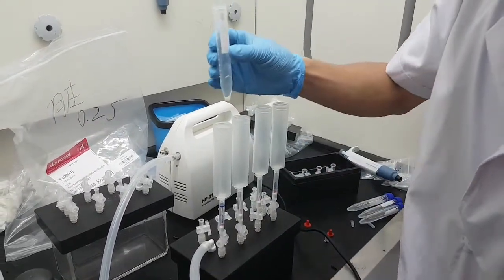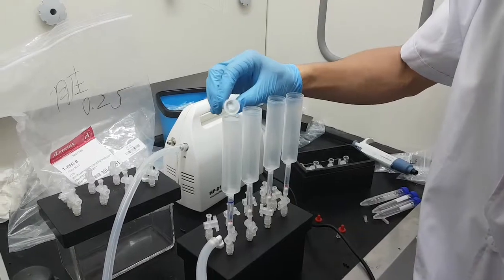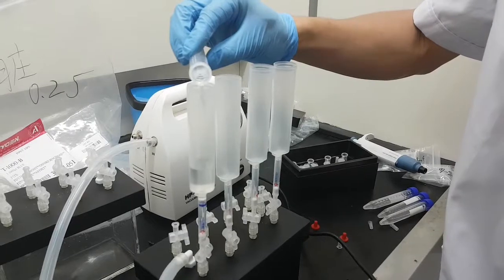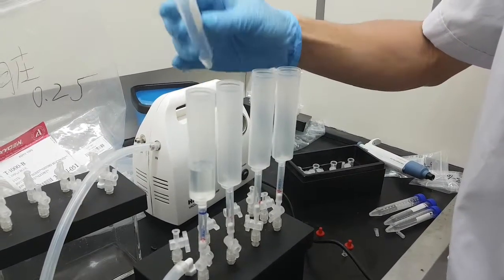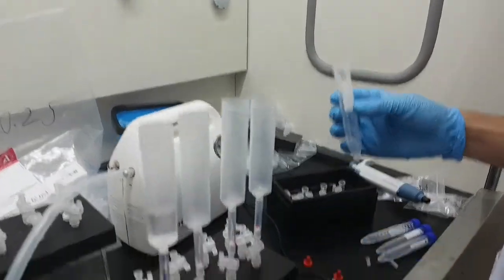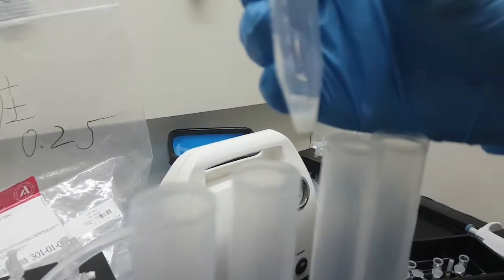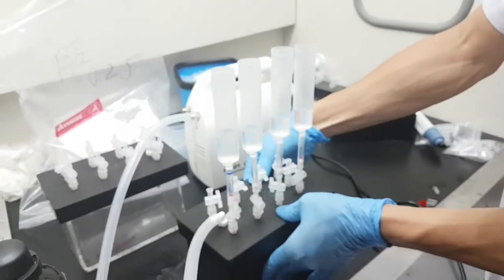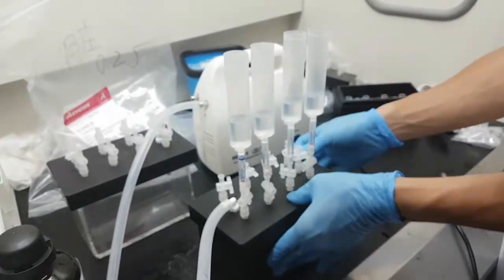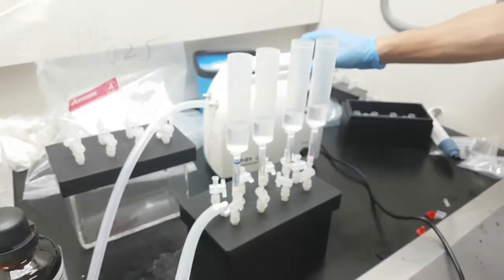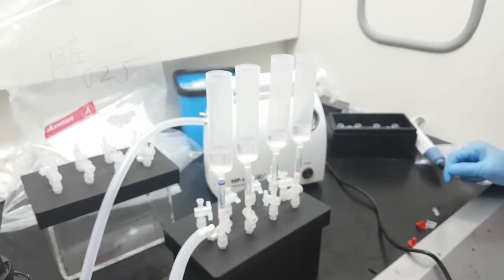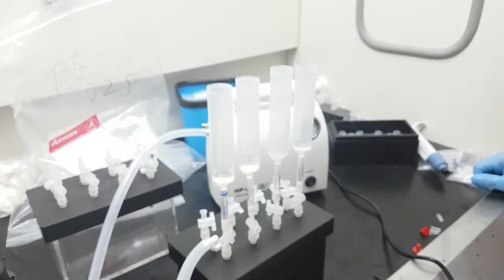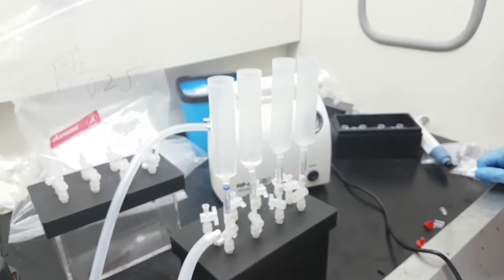Put the syringe just right. Open the other ones. Now I will pour the supernatant and make sure you do not pour the sediment. Turn on the vacuum pump and let the liquids flow through the extraction column.